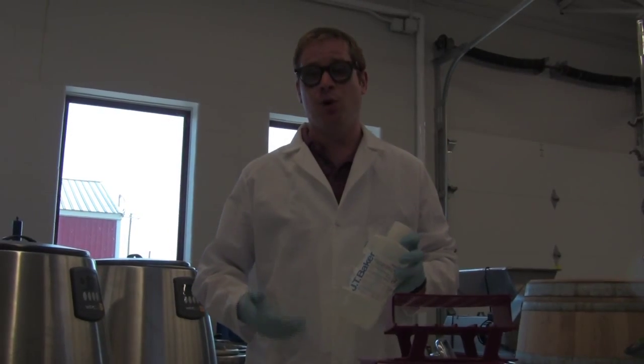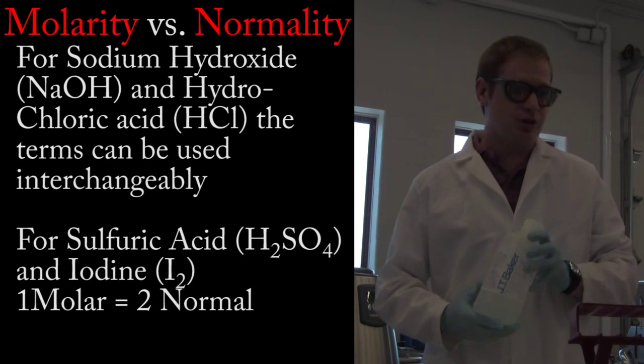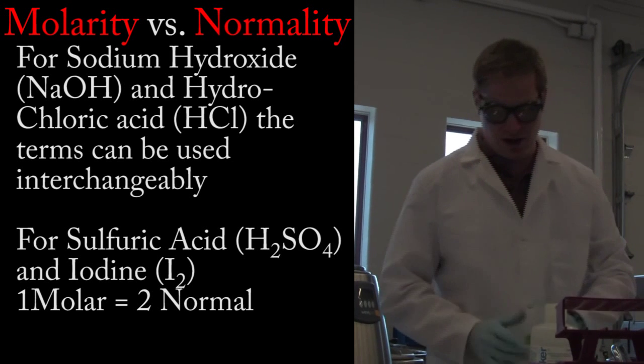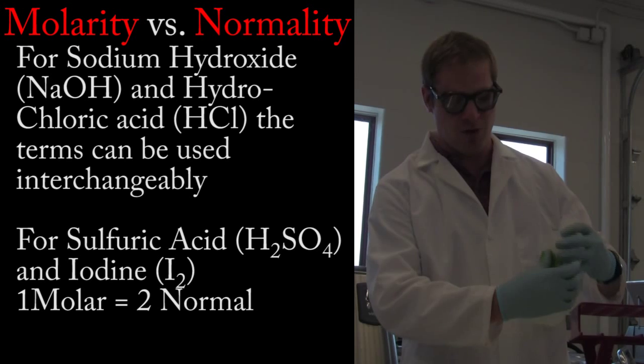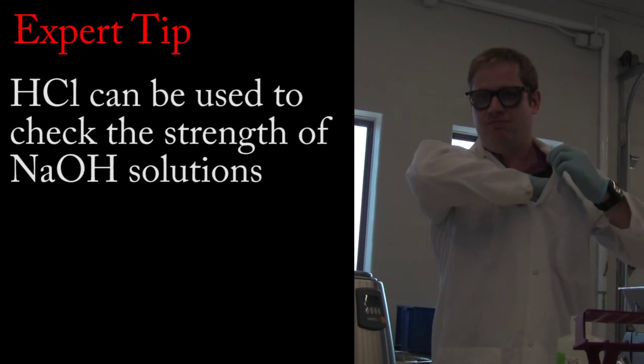Today we're working with 0.1 molar sodium hydroxide. This can weaken over time, so it's important that we put a label on it with the date and when we opened it, so that people know how old the material is.